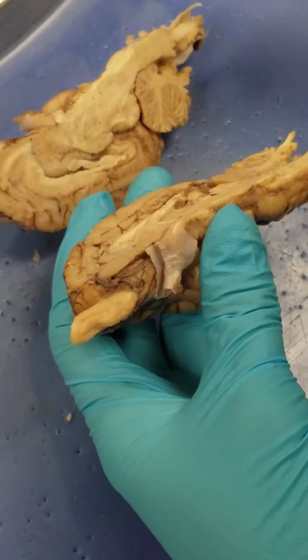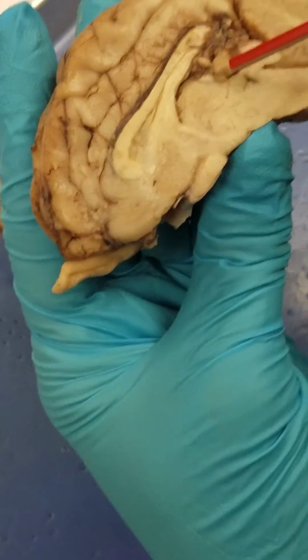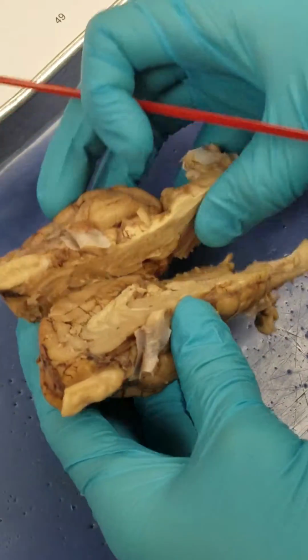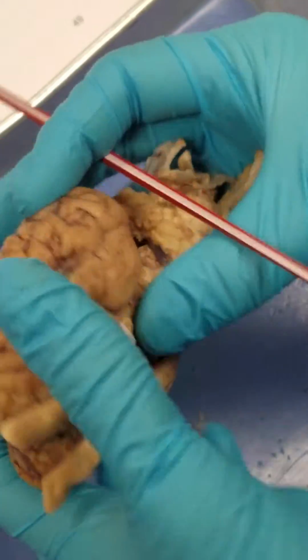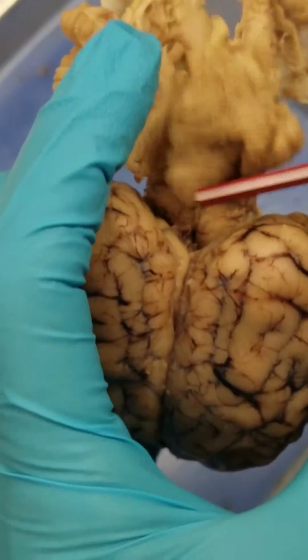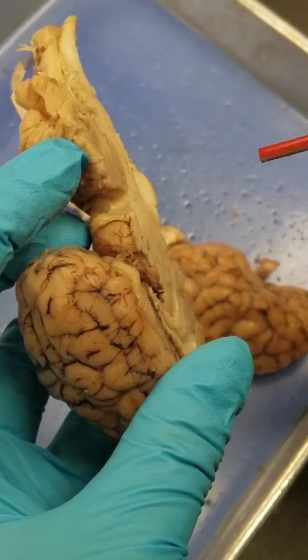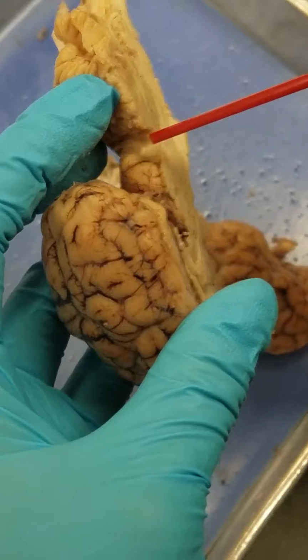And then our pineal body is this little bit right here. Then we have our mesencephalon, which is the corpora quadrigemina, which, if you flip it here, there are these four pieces that look like two little butts here. Sorry, hard to tell. But once it's split and he's testing us on it, you have to know that they're also called the superior colliculi and the inferior colliculi, and here on the bottom are the smaller ones.